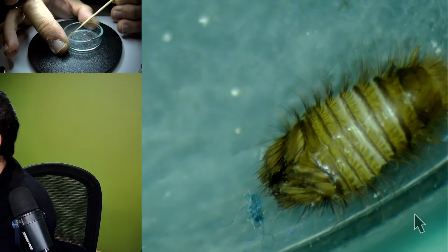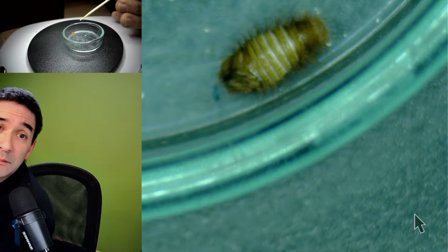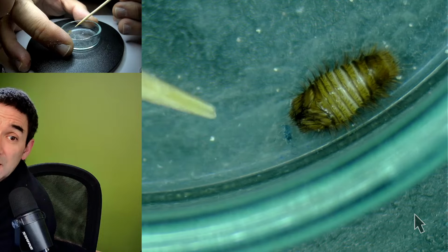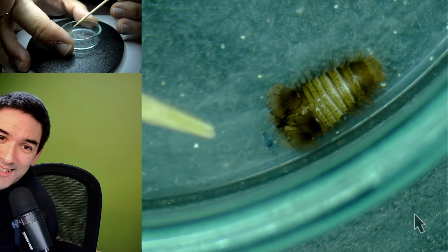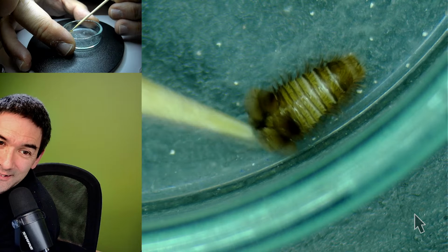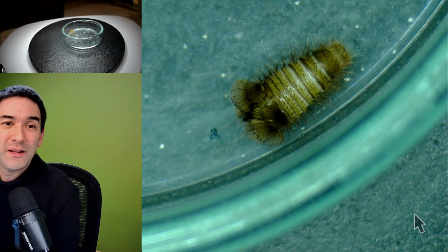Just a second, I don't know where it is now. No, I'm going to zoom out. Because actually last time when I tried that, it moved its bristles a little bit. Just carefully touch it, let's see. Did you see this? Yeah, how it extended? The bristles here in the back.